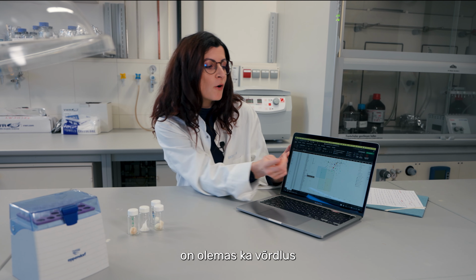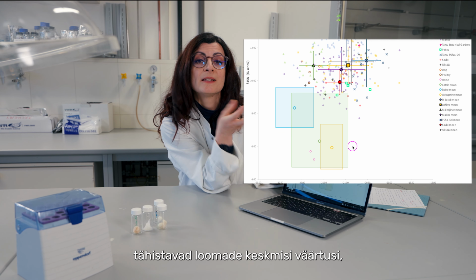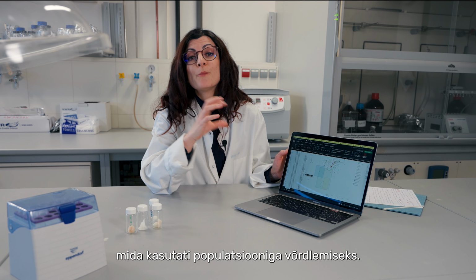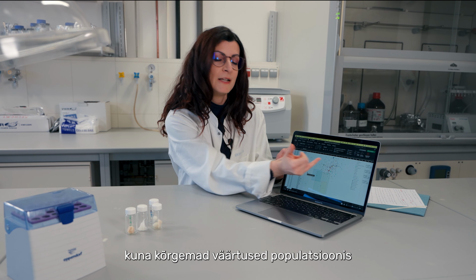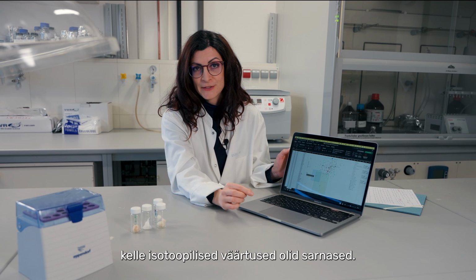In this case, we also have the comparison with the animal values. So these squares here represent the mean values of the animals that were sampled as a comparison with the population. So this is useful especially for nitrogen, because you can see higher values for the population, indicating that they were consuming animals with similar isotopic values.